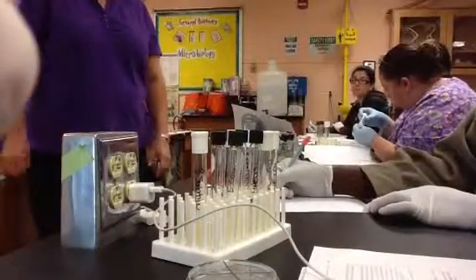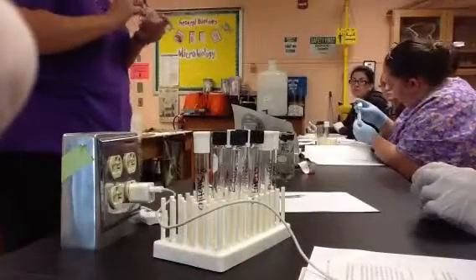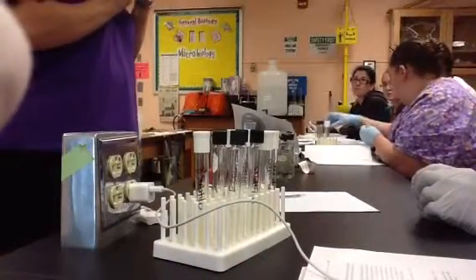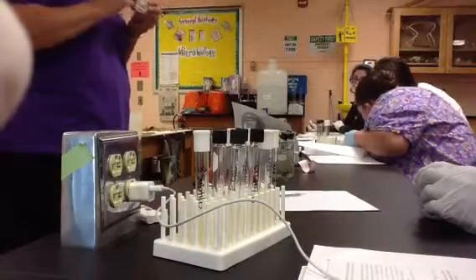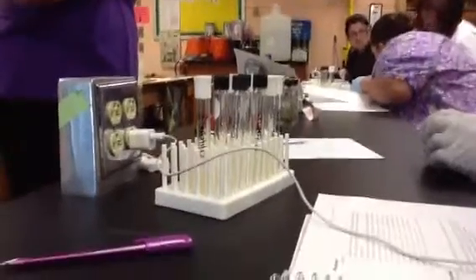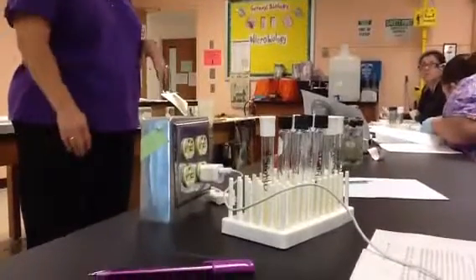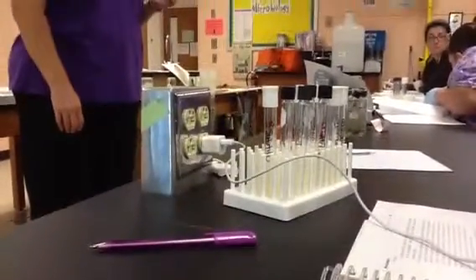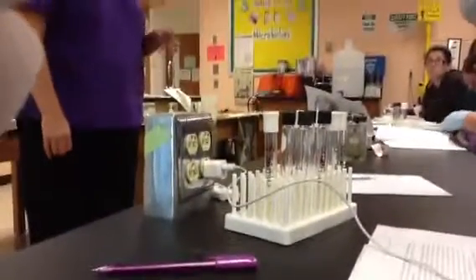For your Petri dish in lab 8, your streak plate, most of you did a pretty good job. As long as you've got one little isolated colony, one little dot of bacteria that's not touching any other dots of bacteria, we're going to consider that successful. The more you have, the better, but as long as you've got at least one that's not touching anything else, then you have done what you're supposed to do. Remember, with a streak plate you're spreading them out on the surface, and the goal was to get isolated colonies, mounds of bacteria that weren't touching any other mounds. They all came from one original one that you spread out across the surface.